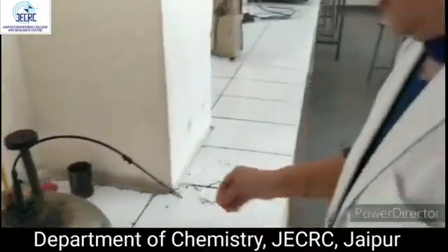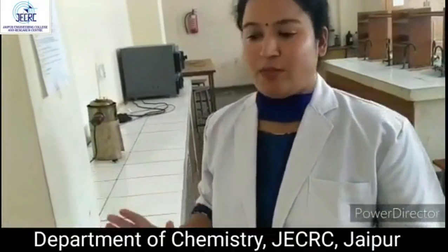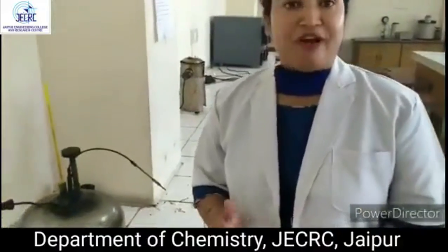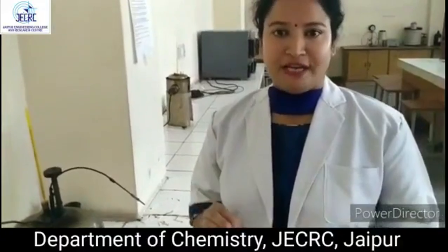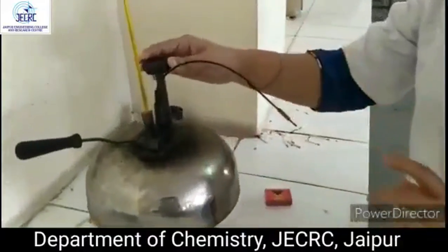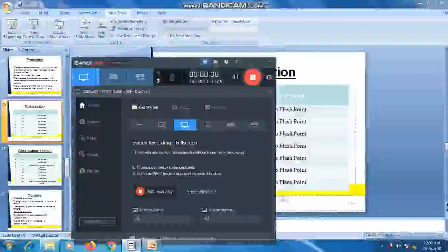This way we observe the fire point of the lubricating oil, and this is all about the flash and fire point experiment. And what is the fire point? The fire point is the temperature at which the flame stays for 5 seconds at the pilot burner. So this is all about the experiment. Thank you.